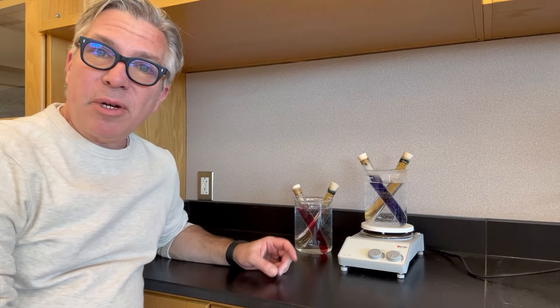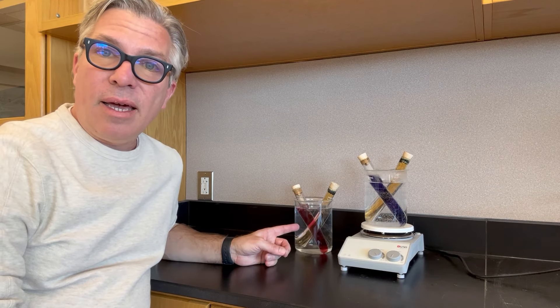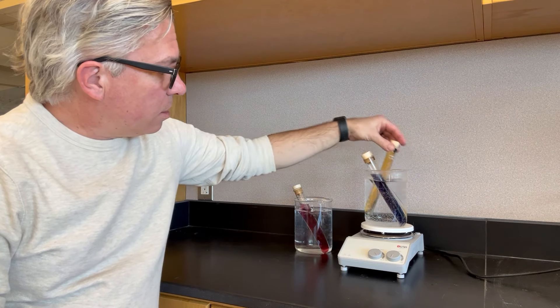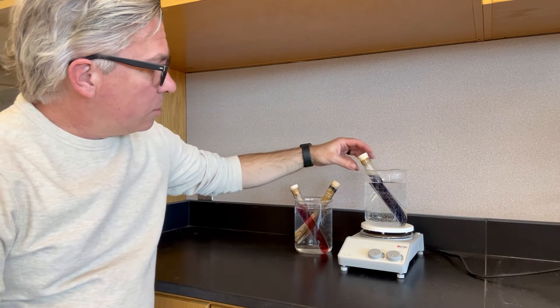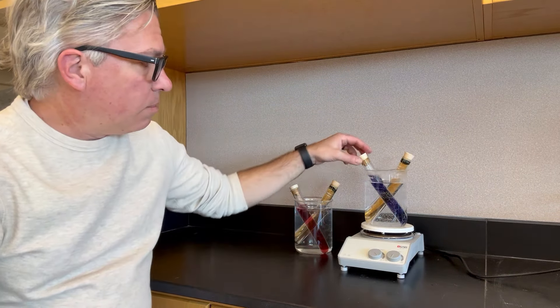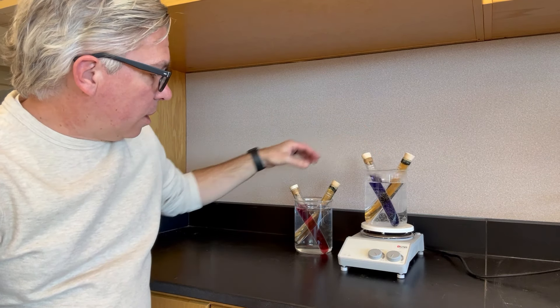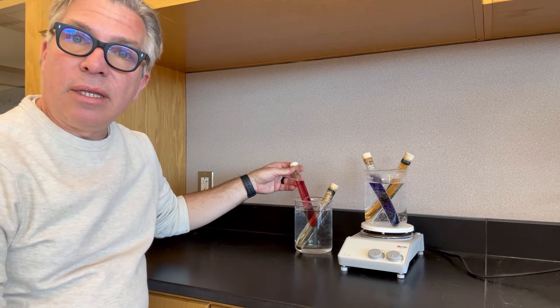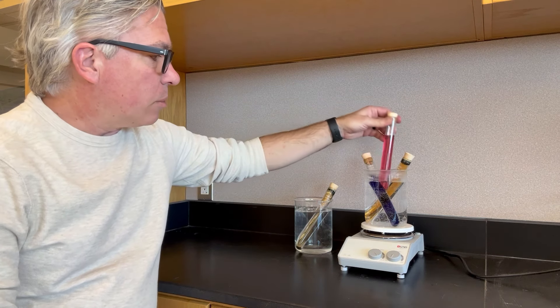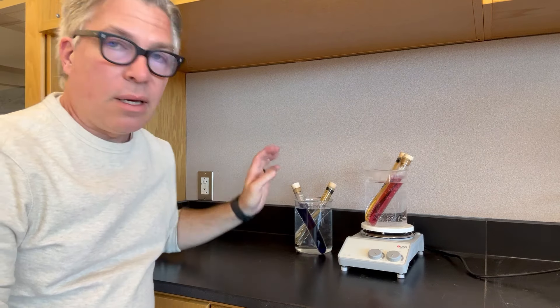Both of these experienced a change when going from cold to hot and hot to cold again. I can shift them back the other way by just switching them back to hot and cold. The cobalt chloride solution went more purplish, almost a blue color in the hot water, and then went back to being a pink color in the cold water. If I change them back and forth, I'd see them change in exactly the same way.